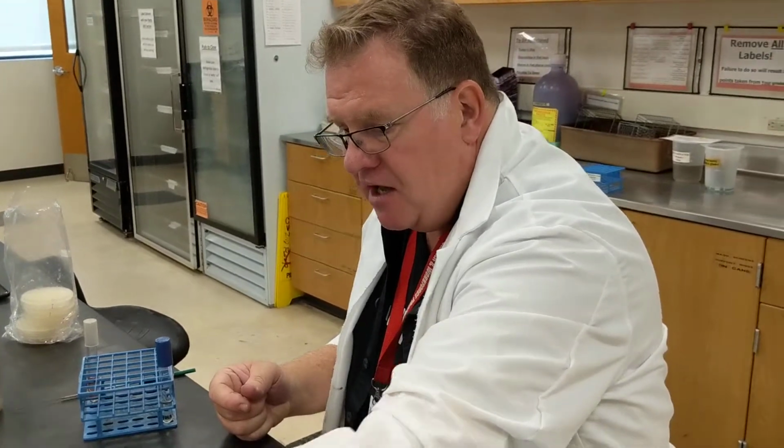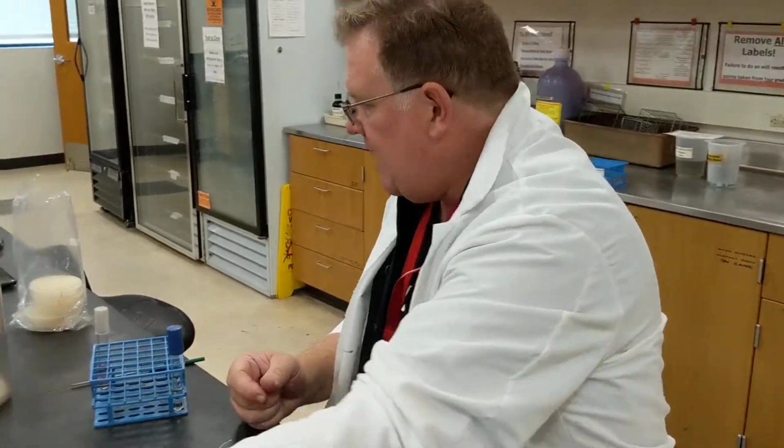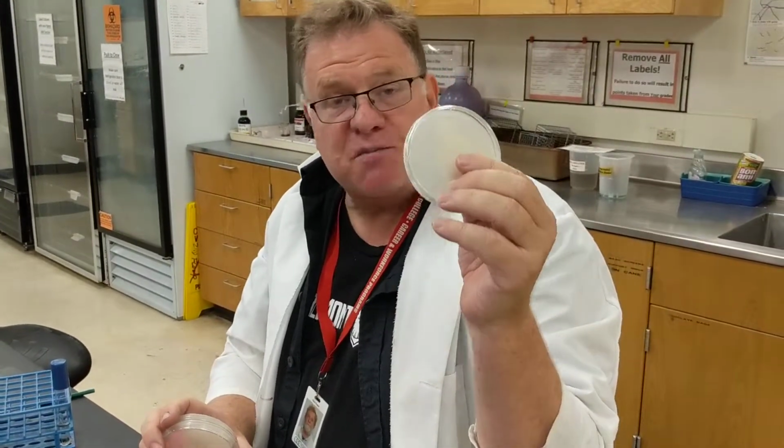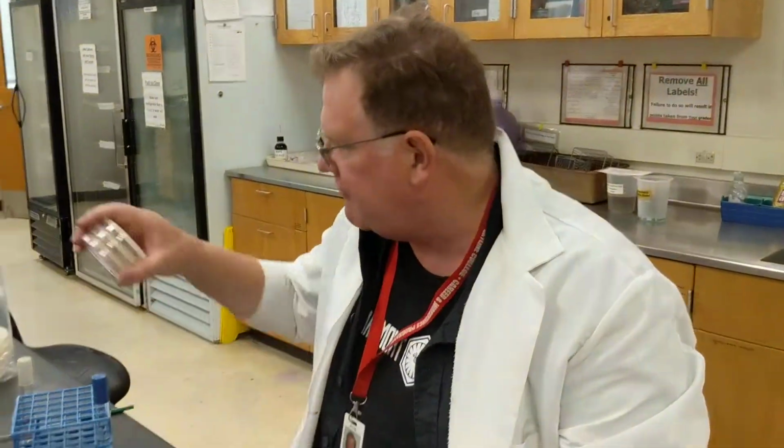In lab number 8, we're looking at the effects of temperature. You're going to have a demo. We'll have several plates out. One that has just plain dirt on it, one that will have dirt that's been autoclaved, and another one that will have dirt that's been heat treated overnight. And we'll see what the growth is of those.